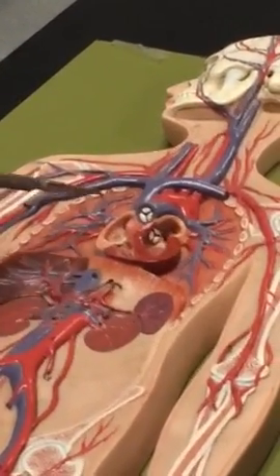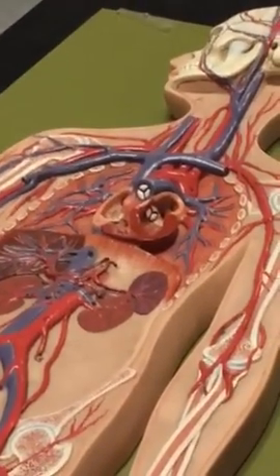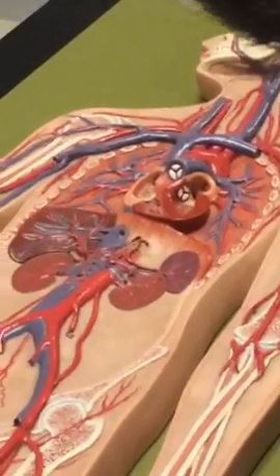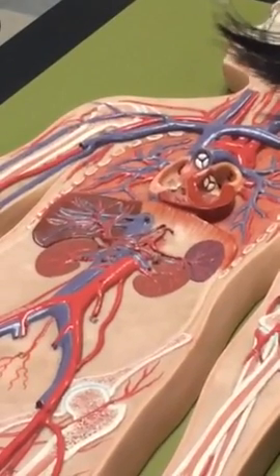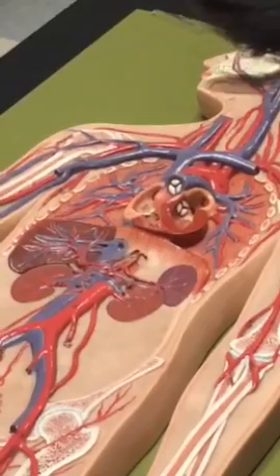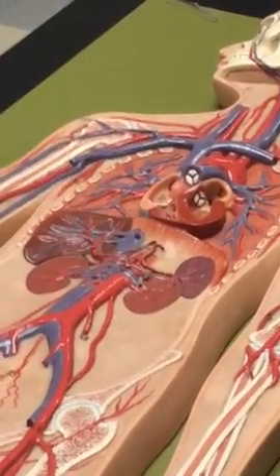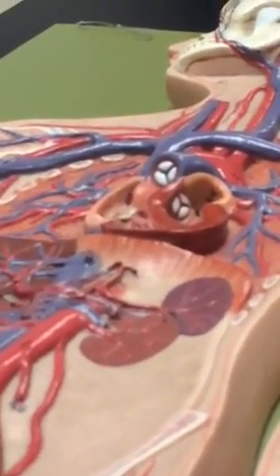So either the left or the right, the blue. Okay. Hold on. It's just like on any heart. Left atrium. The left atrium is under there. Left ventricle. This guy down here. The bicuspid valve. It's not even there.